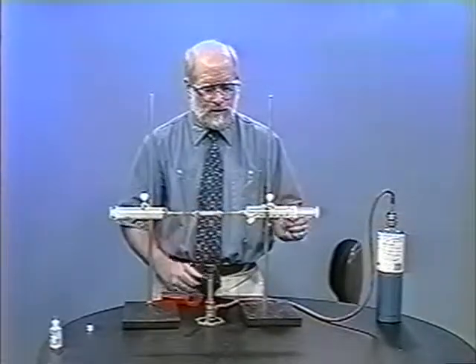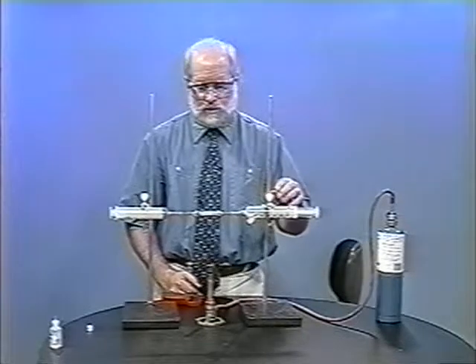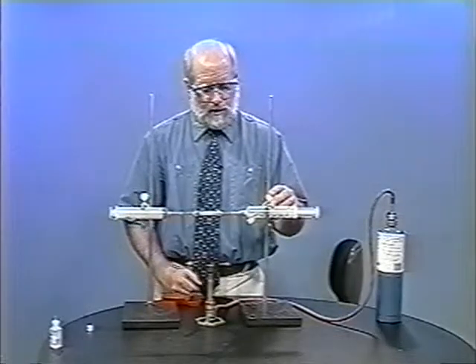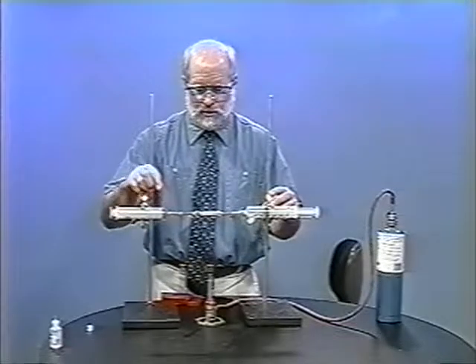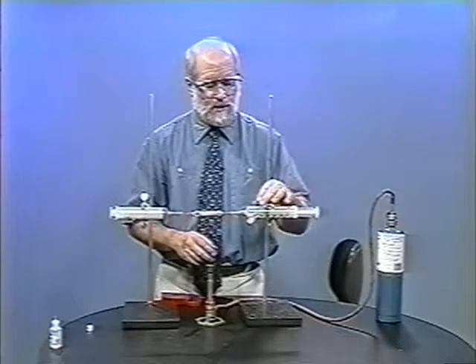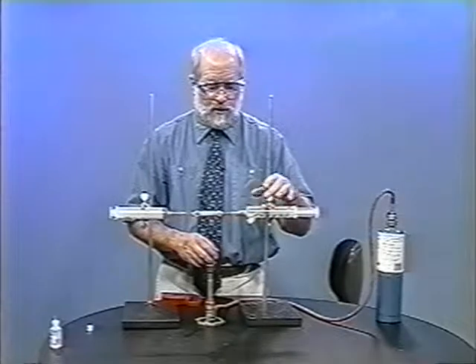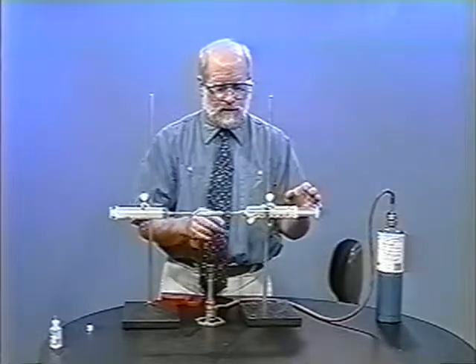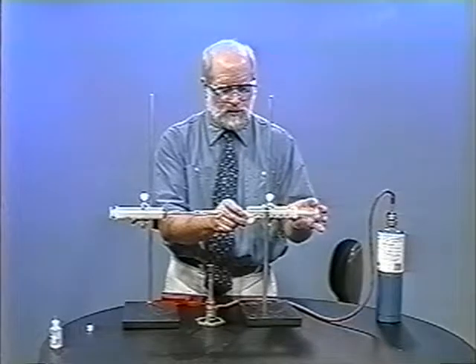We may end up going back and forth, and we can tell when the reaction's over because water vapor is made. We want to make sure that the plungers have been lubricated before the setup, and they have. The only thing left to do is we want to react the methane with oxygen — not pure oxygen, but just the oxygen from the air. With pure oxygen, the reaction would be explosive.